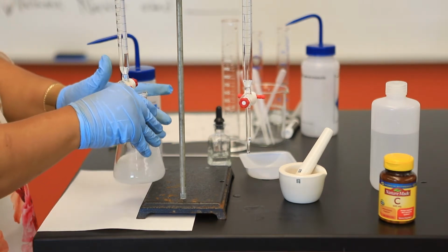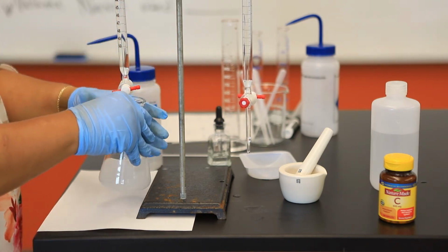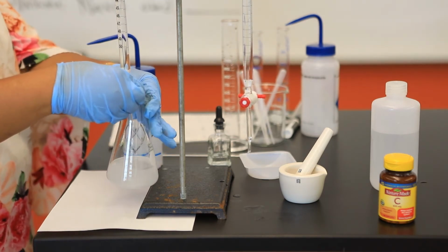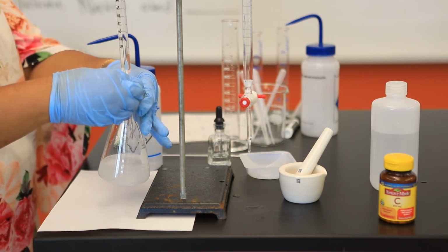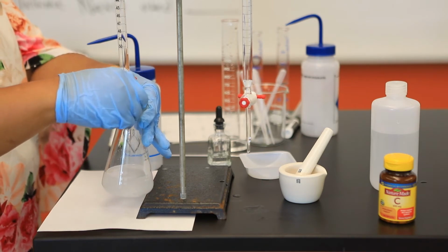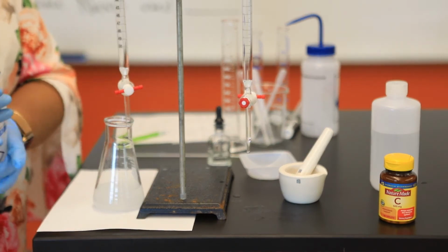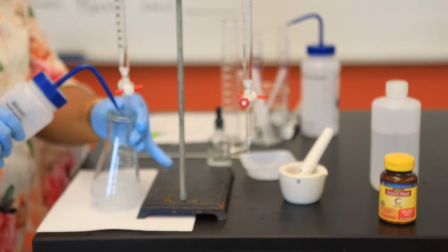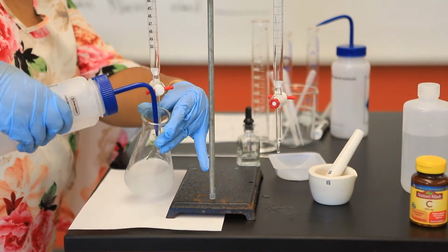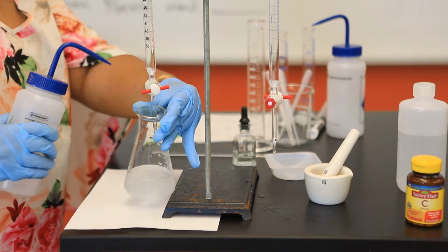Alright, so I know that this is going to take approximately, and you can actually calculate backwards, 20-something mLs. So now that I'm at about 20 mLs, I'm going to make sure that I do this slowly. Okay. Using my wash bottle, I'm going to take a minute to wash the inner walls of my container in case there's any sodium hydroxide solution adhering to the walls.